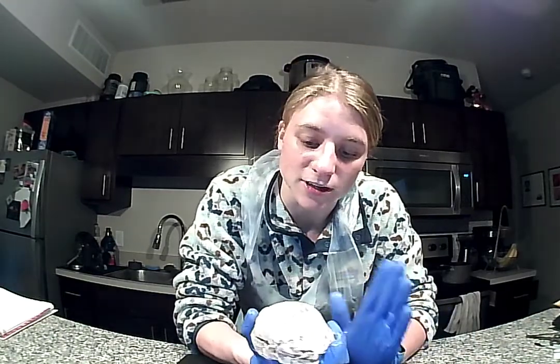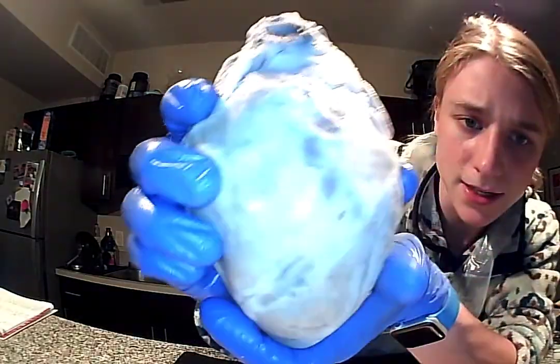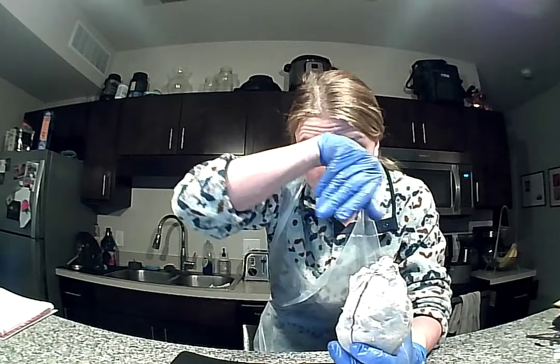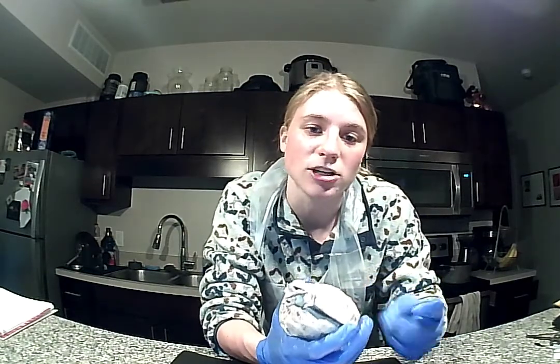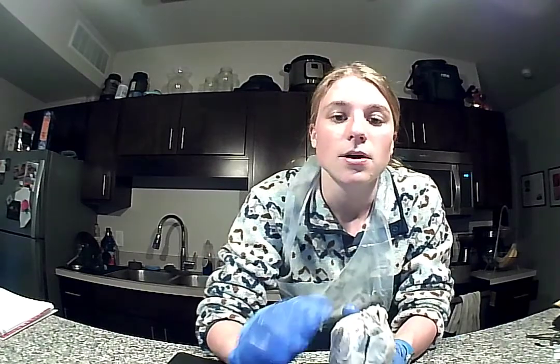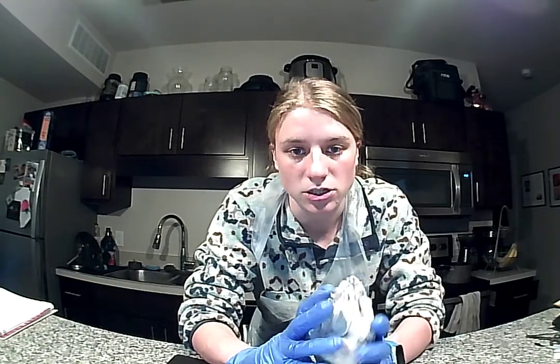The next superficial feature is the coronary arteries, which are not very visible on this heart, but I will go over them. So they originate at the base of the aorta, and there are going to be two types which branch off into two other arteries each. So we have the right coronary artery, which is going to branch off into the right marginal branch and the posterior interventricular branch. And then we have the left coronary artery, which is going to branch off into the circumflex branch and the anterior interventricular branch.